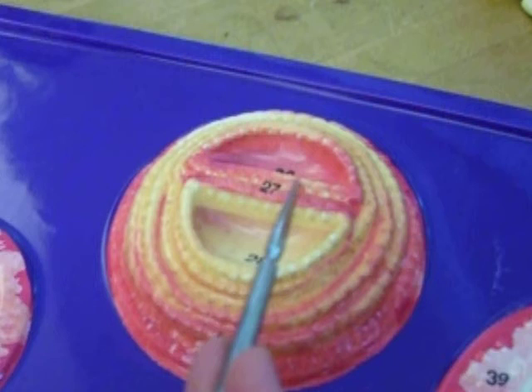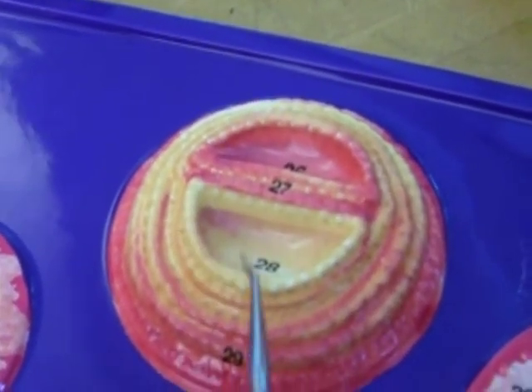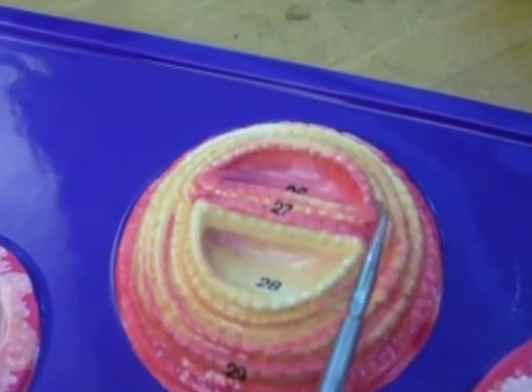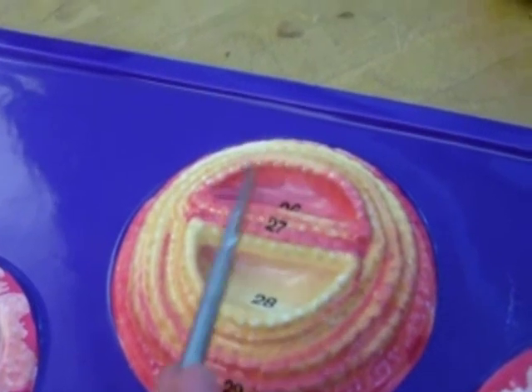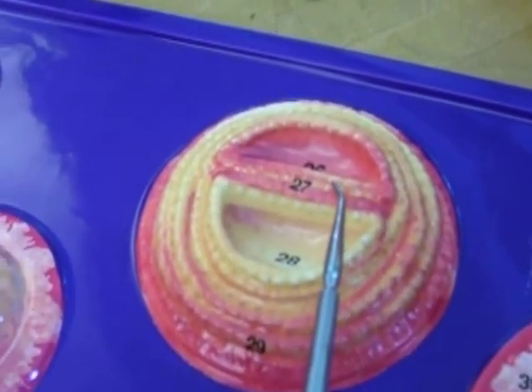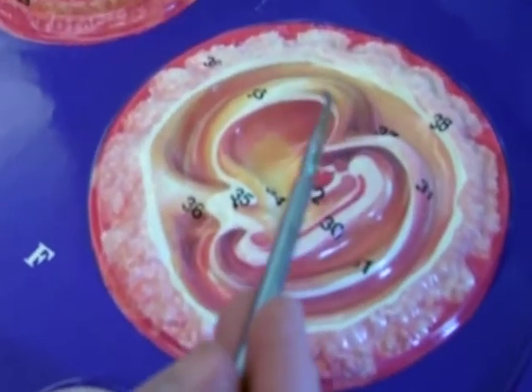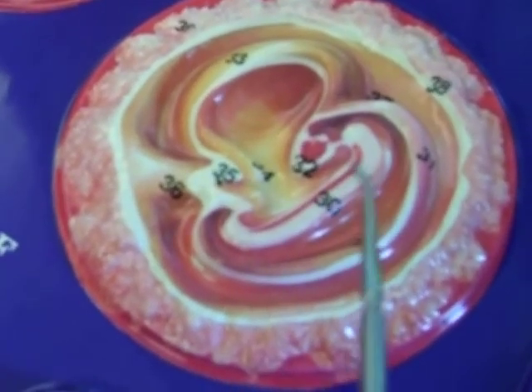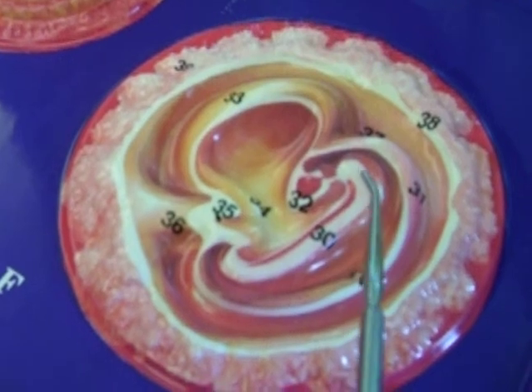You'll notice some of the cells here will differentiate into one structure and another one down here. This is that bilaminar layer that we talked about in lab. One end of it will become the yolk sac, and the other end of it will become part of the embryo and other embryonic structures. You can see in this cross-section right here, you have the yolk, you have the conceptus or developing embryo. It is a neural tube right here.